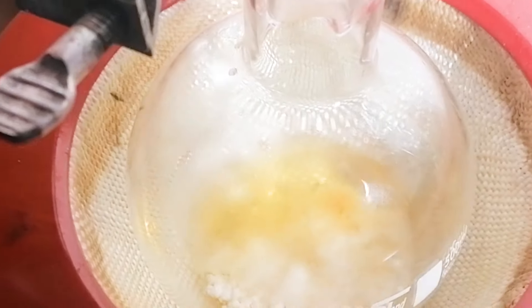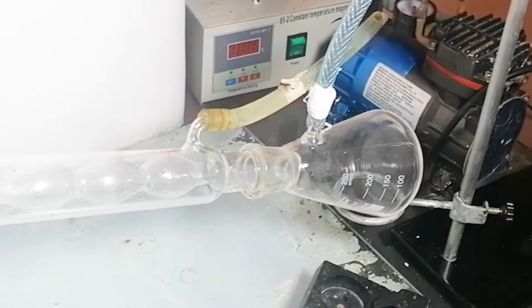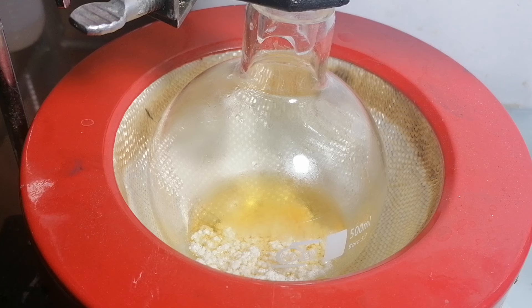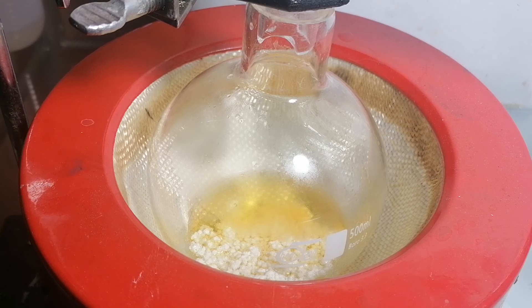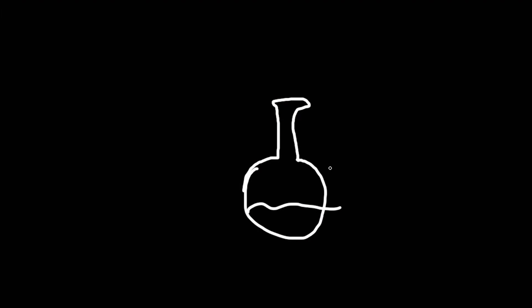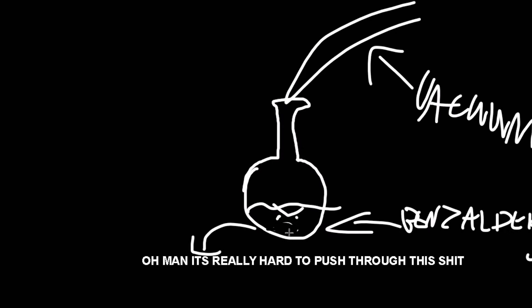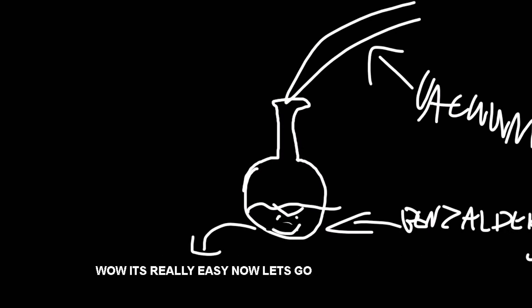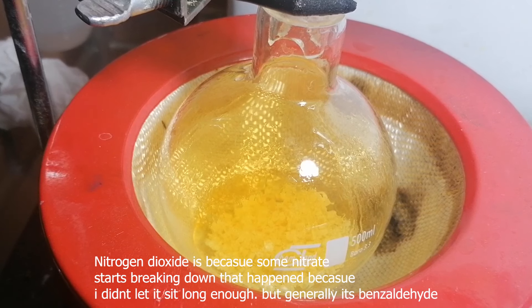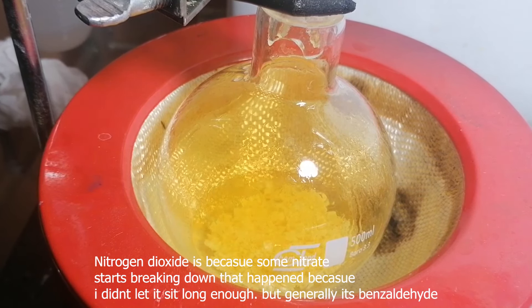Benzaldehyde has a boiling point of 180°C, and if we heat it at that temperature it will most likely break down our product. So I started pulling a vacuum, which decreases the pressure in the whole system and lowers the boiling point of benzaldehyde. That's because the smaller amount of air molecules in the apparatus means it's easier for benzaldehyde to jump into a gas. After turning on the heat, everything started boiling, and eventually there started being a bunch of nitrogen dioxide vapors.